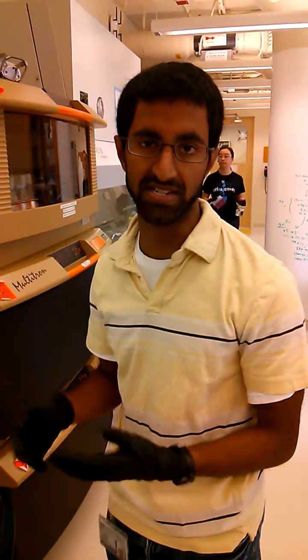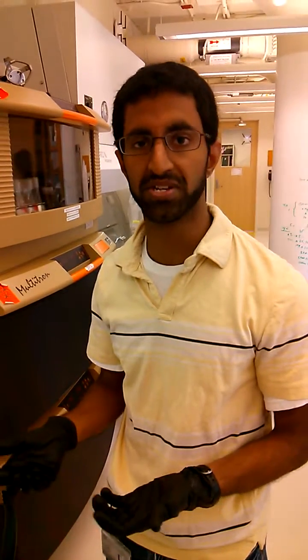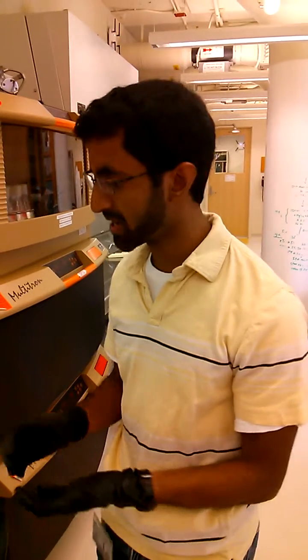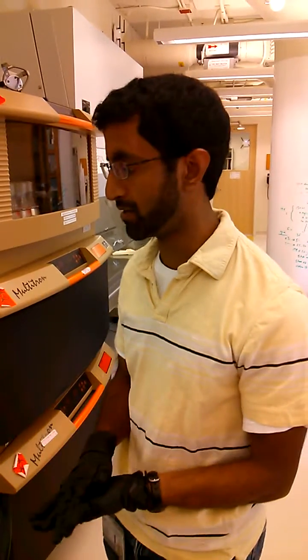This video is just a really brief intro to P1 transduction. There's going to be a guide online that explains in great detail all the different volumes and ingredients needed to do this, and you should definitely check that out.